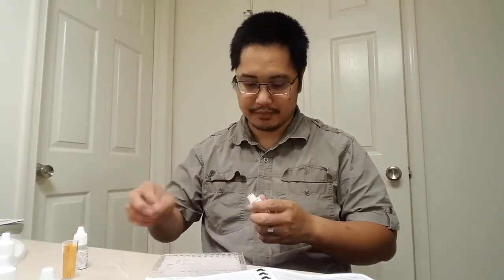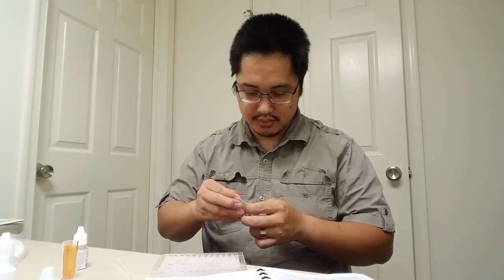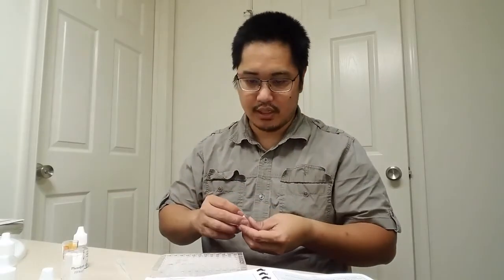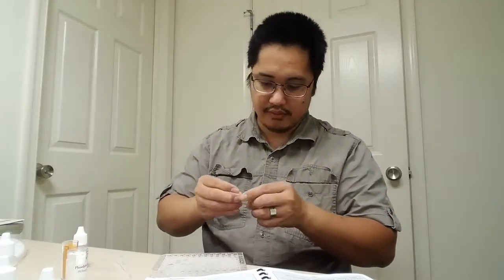So we did A, and we used up all of A using these test strips. Now let's try this phenolphthalein test paper. I know this one's a long video because this one's kind of involved. I'm going to try going one on each side. In fact, I'll probably just rip off a small piece.